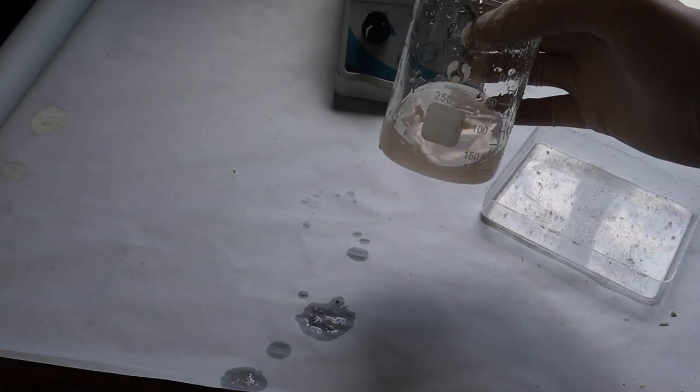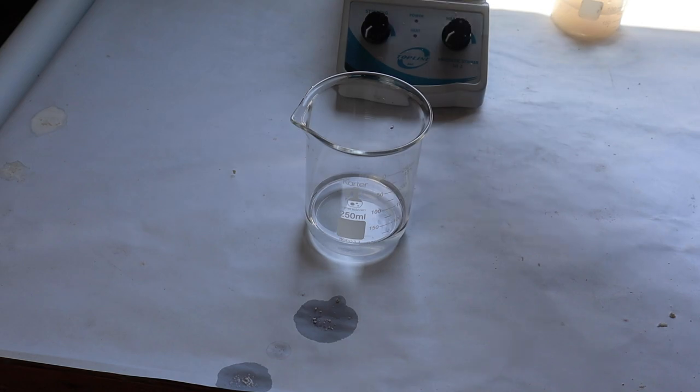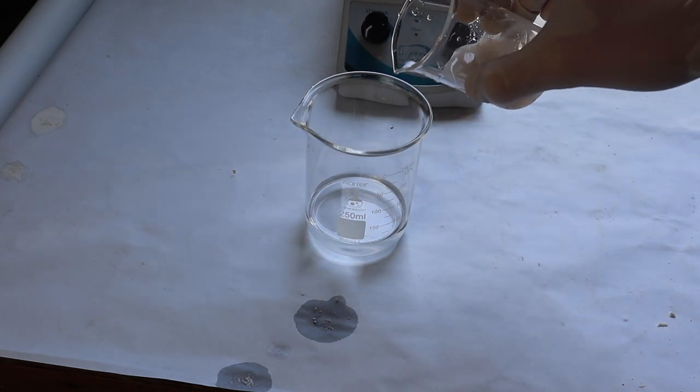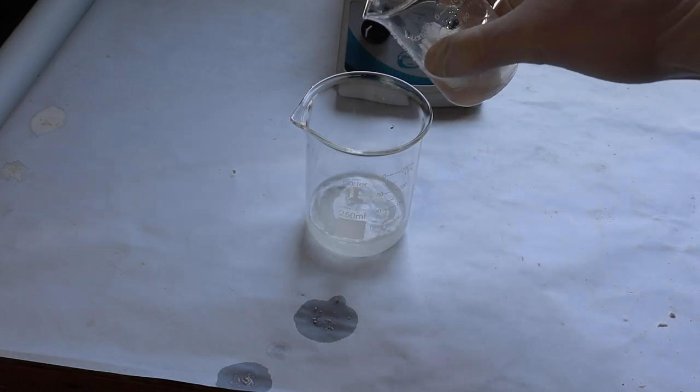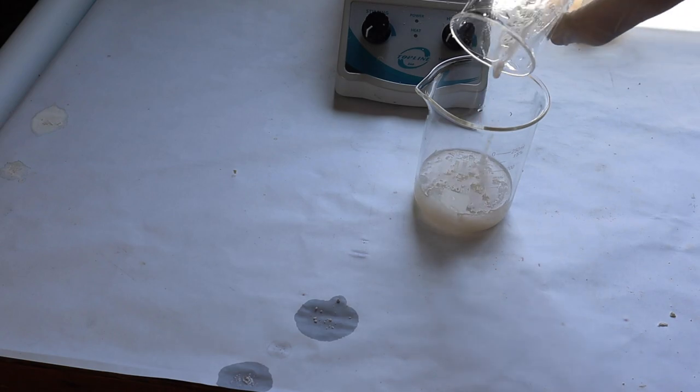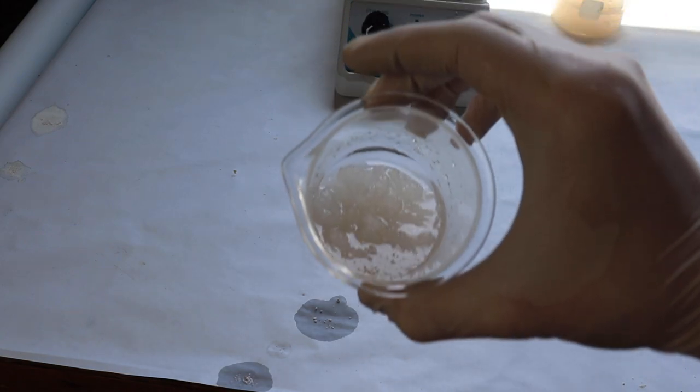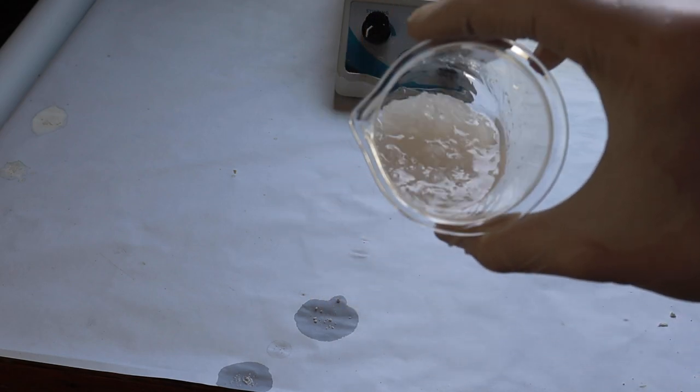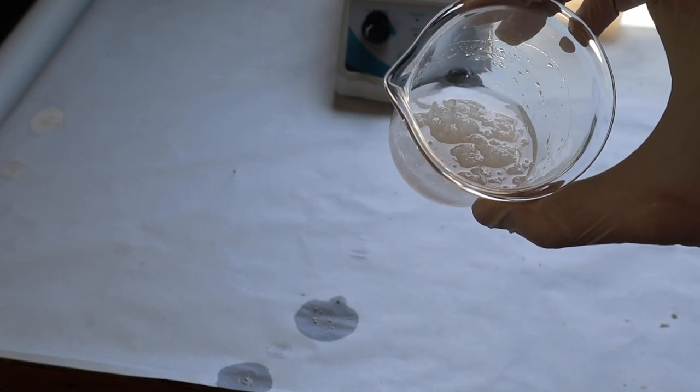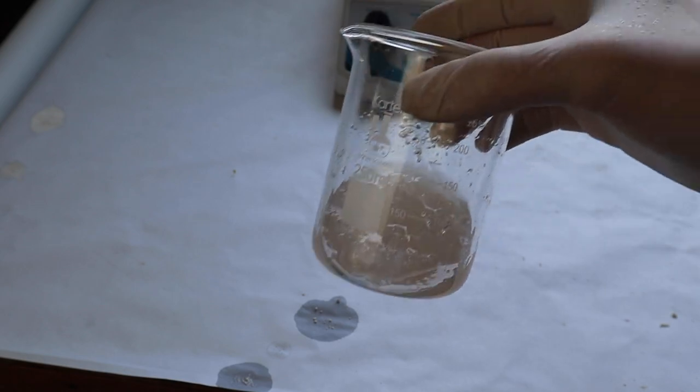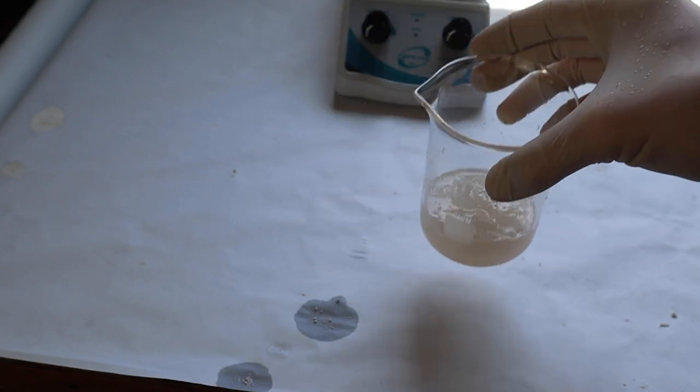So I'm going to retry that now. Let's hope it works this time. Let's dump the rest in. So my measurements were a little bit off so I'm just going to dump the excess out and then grab the jelly and we're going to see how it performs. We're going to light it on fire.